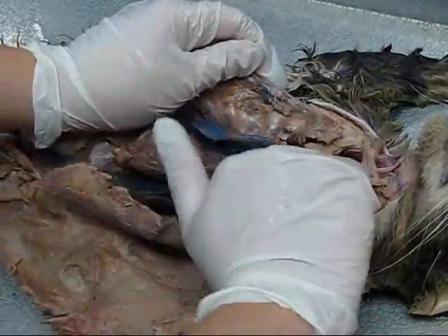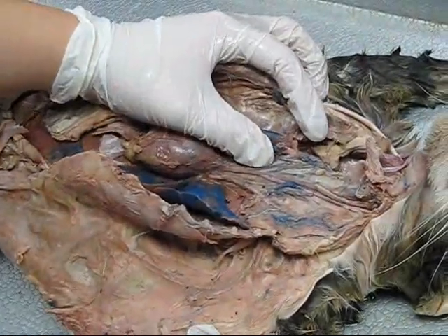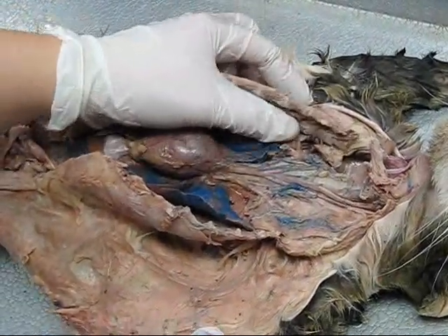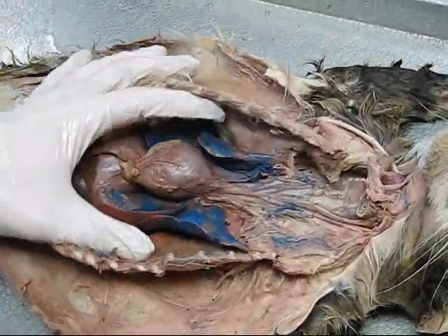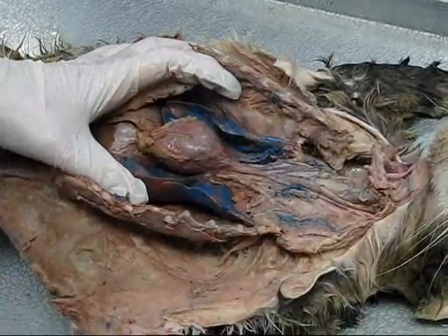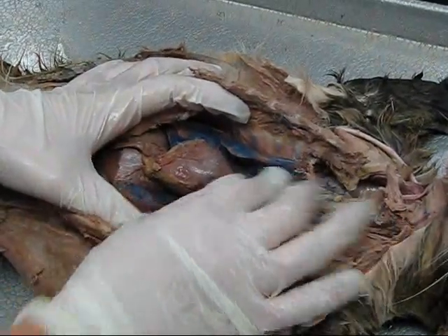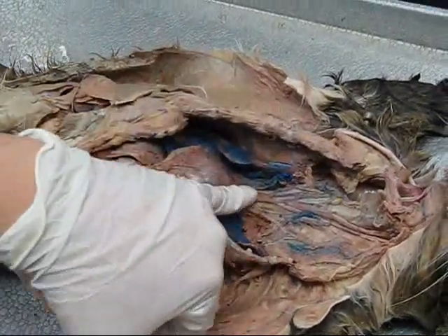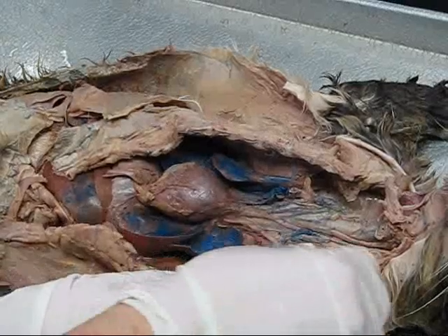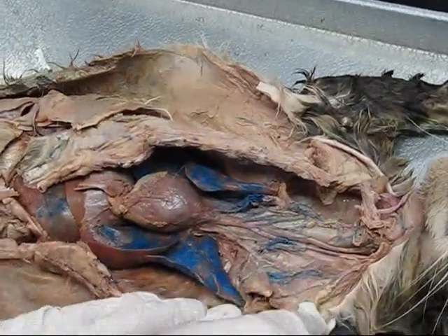Always remember the carotids come on either side of the trachea. Subclavian will be the first part where it branches off; in the armpit it's axillary, and closer to the arm is brachial. The thing that's confusing here is you only have one brachiocephalic coming up through here, and then your left subclavian comes directly off your aorta — right here. And then up here would be kind of where his axillary would be because you're getting close to the armpit.